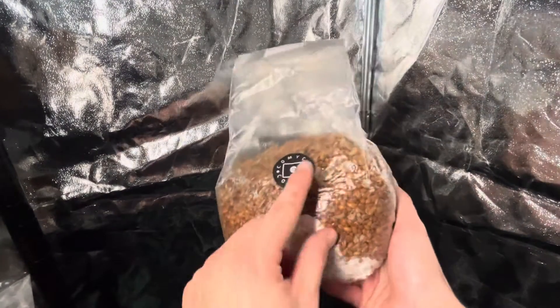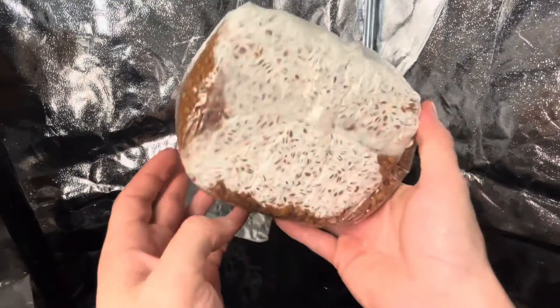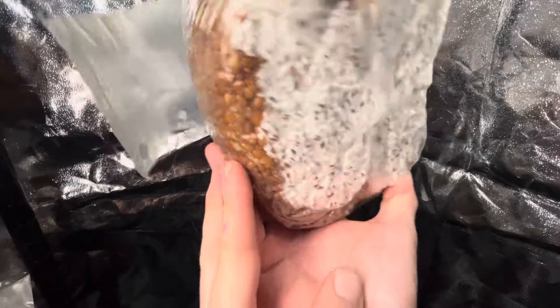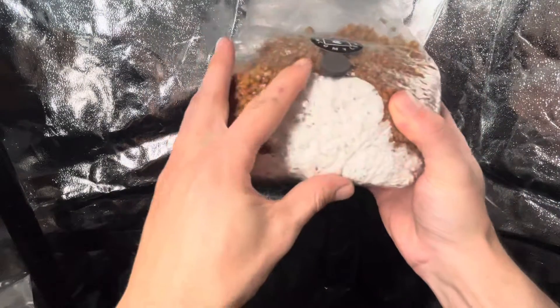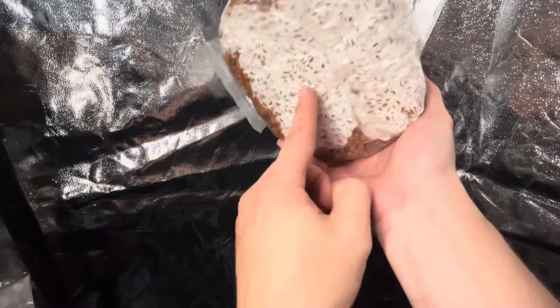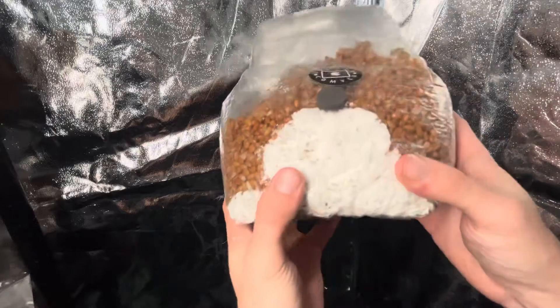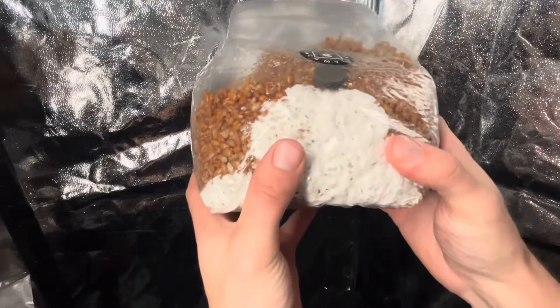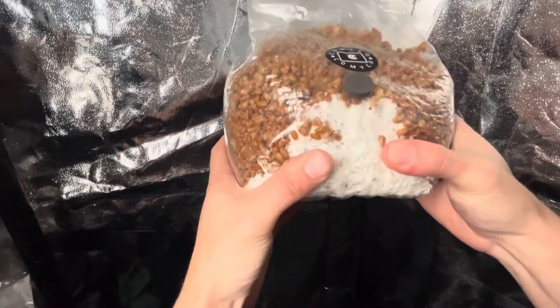So let's take a look at our rye now. This one has the old company logo — it's kind of an older bag, this one has been sitting for a while. It's funny, you can always see how the liquid culture comes in and then just pulls at the bottom. But it's going to be more difficult to break and shake this one. Let's go for it.